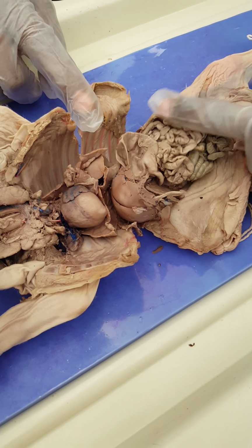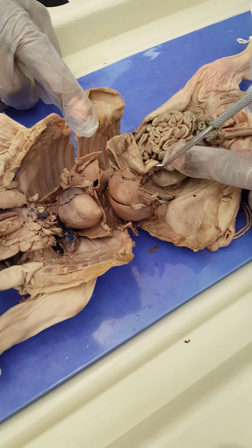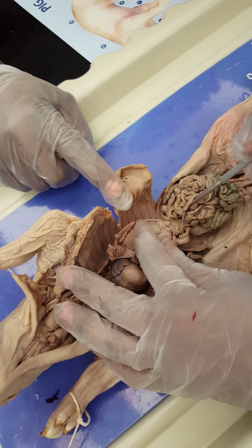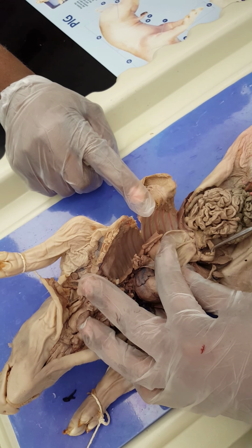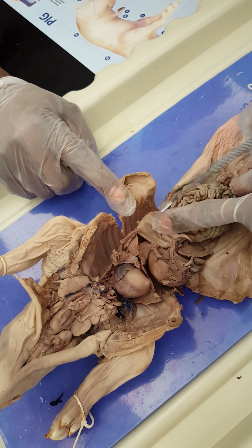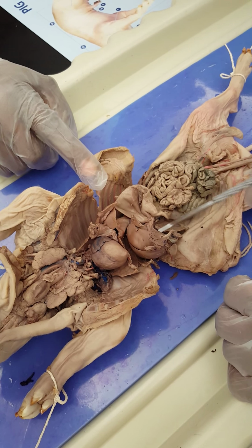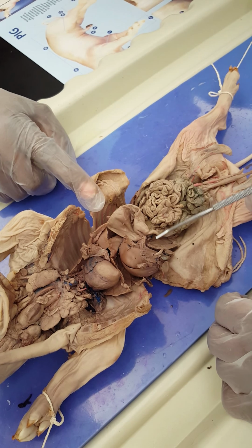Common bile duct here, which opens onto the duodenum, and this is the duodenum here. How do we know this is duodenum? Let's take the stomach first. We're going to find the stomach first, which is this big sac here, and the C-shaped part that's connected at the end of the stomach is the duodenum. It's C-shaped, and that's where you find the common bile duct opens, okay? So again, cystic duct, hepatic duct, common bile duct. This is a gallbladder.